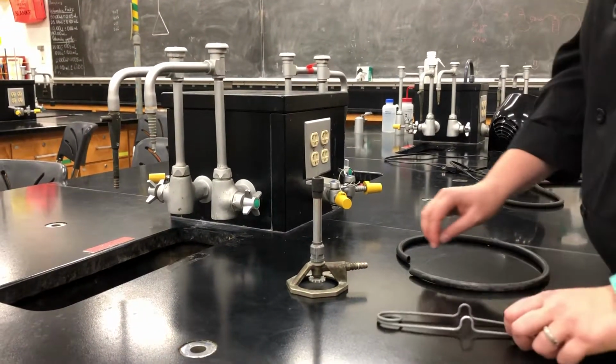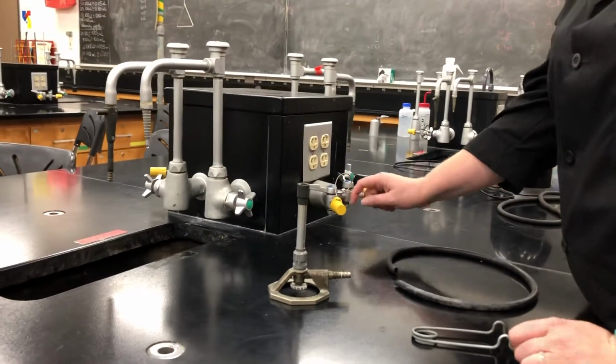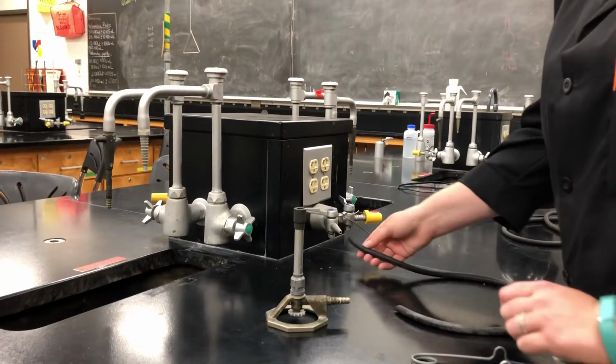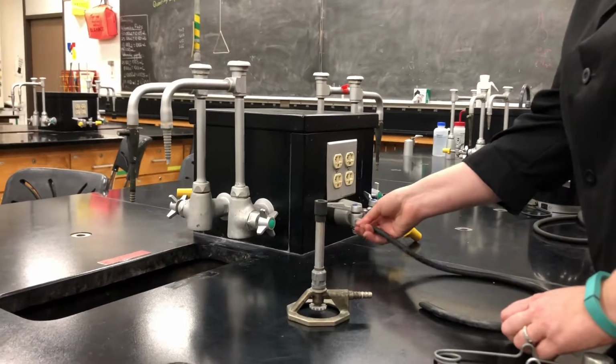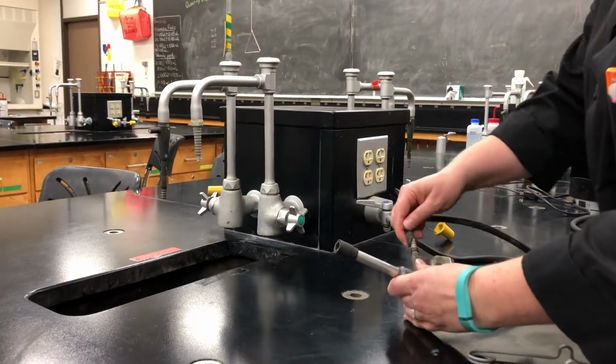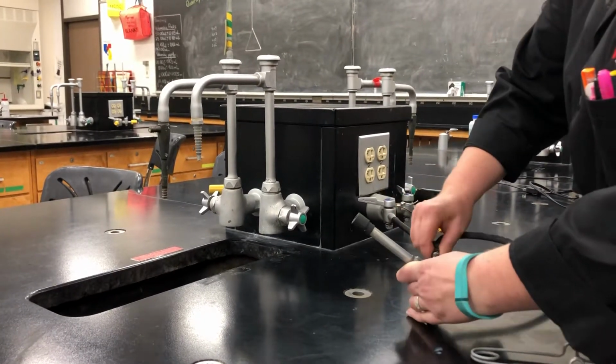Next, we're going to attach our hose to our Bunsen burner and our gas valve. So I'm going to remove the cap from my gas valve and just slide it to the side. And I'm going to put my hose onto my gas outlet and onto my Bunsen burner. And it needs to go on about 1/2 inch onto both of these nozzles.